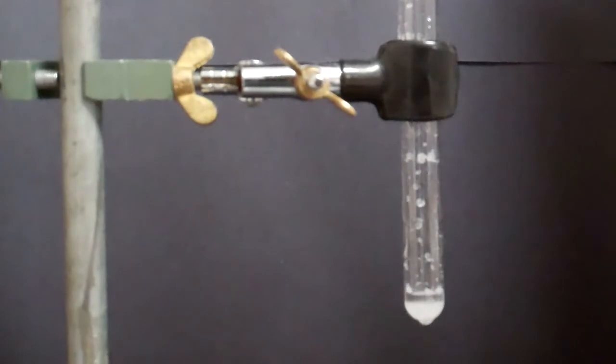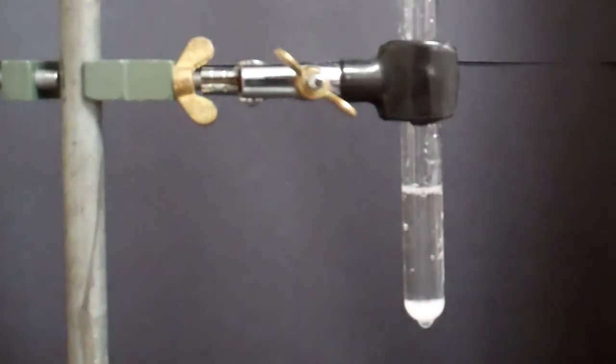I'm going to add in my distilled water to dissolve, so about a third of the test tube. And we'll stir that.